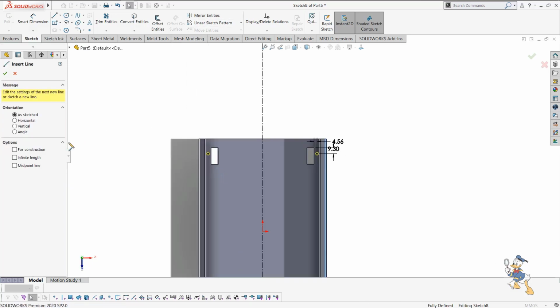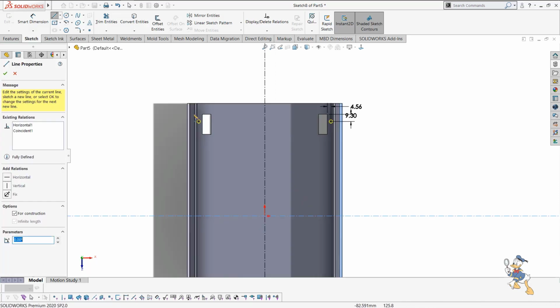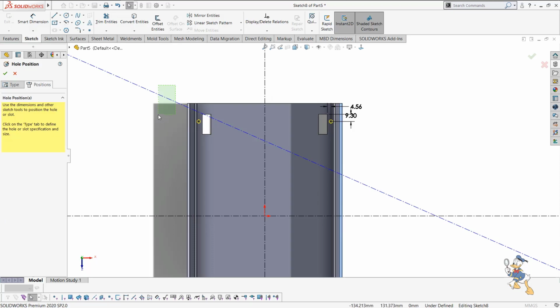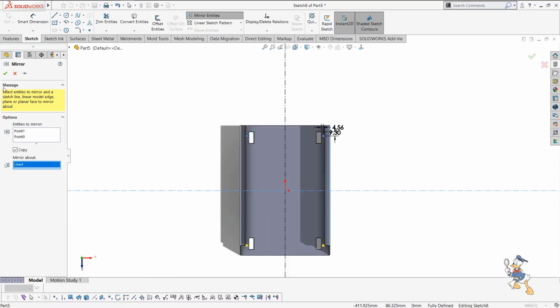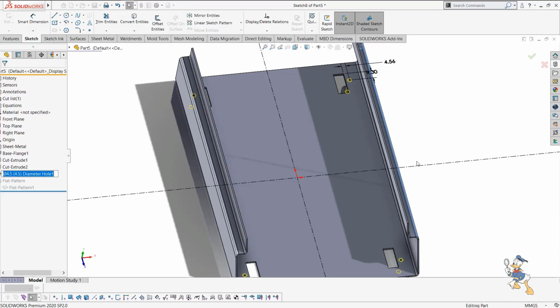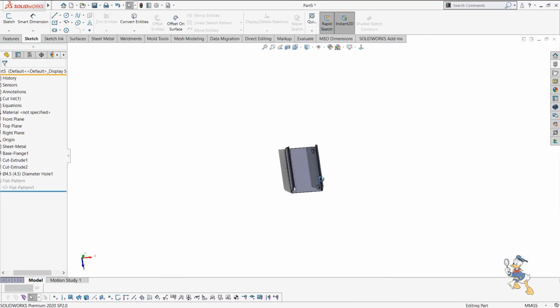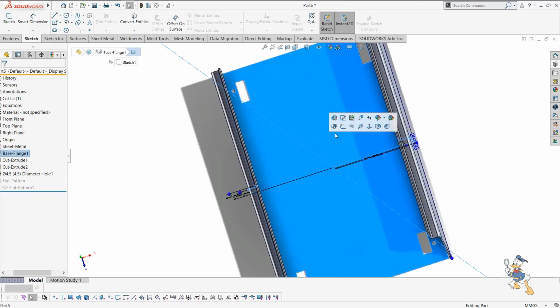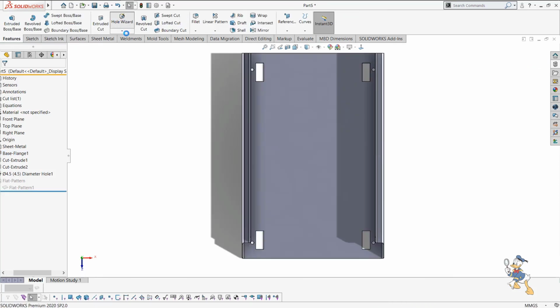We need to mirror also from here, so we can select a center line as well. We just need to select this feature, mirror about this line, and yeah, we got these 4 points to generate holes, and we have generated some holes over here. Suppose we need to generate some more holes over here as well, so we just need to do some sort of sketch, or we can do it just by using the hole wizard feature.